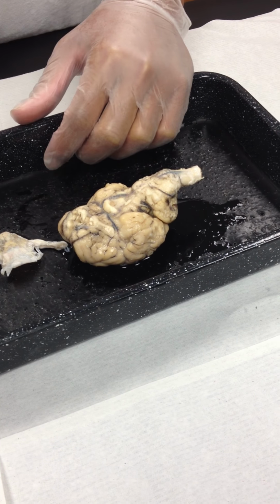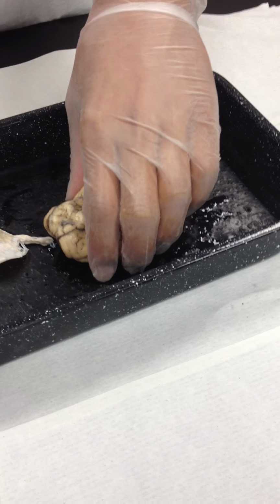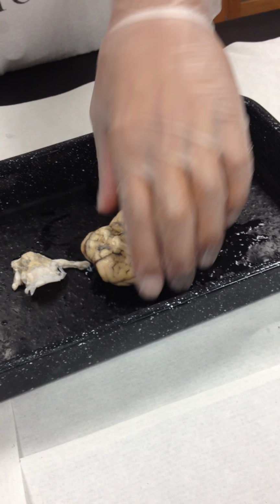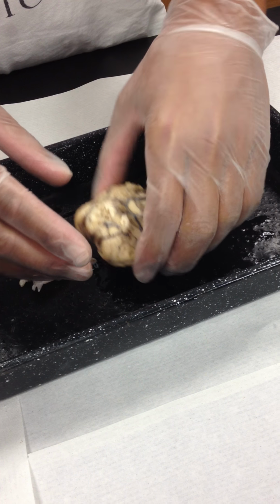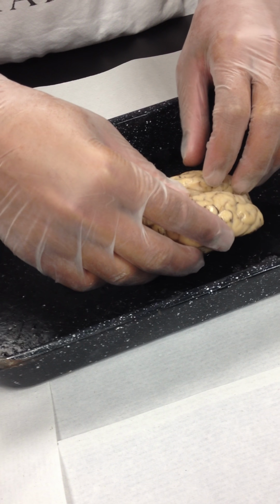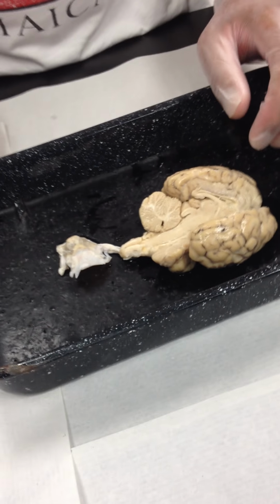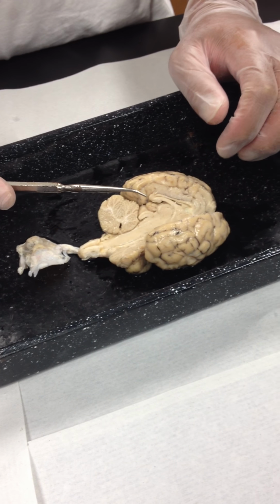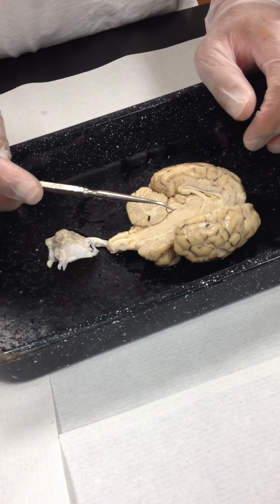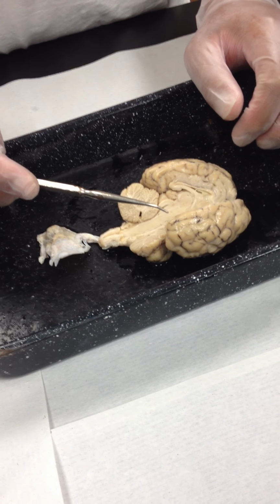Okay, having located those external structures, we're now going to look at the internal structures. We're going to take a sagittal section, so you're going to cut your sheep's brain right down through the great longitudinal fissure, to separate the two halves. Continue the incision right through the cerebellum and down through the spinal cord so that we can fold the brain open into two halves. When you make this cut, you want to do it with a minimum amount of back and forth sawing that you can possibly do. Try to make the cut just a nice, sharp, smooth cut, one single cut if you possibly can.